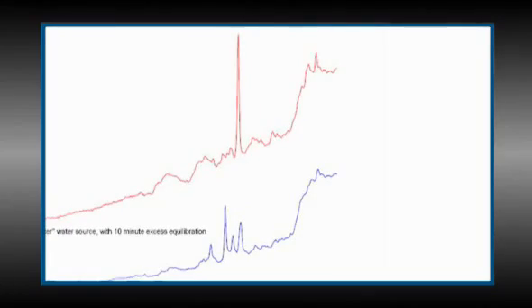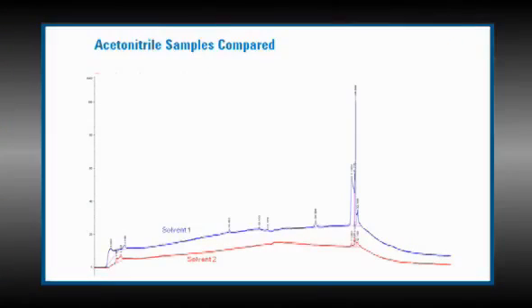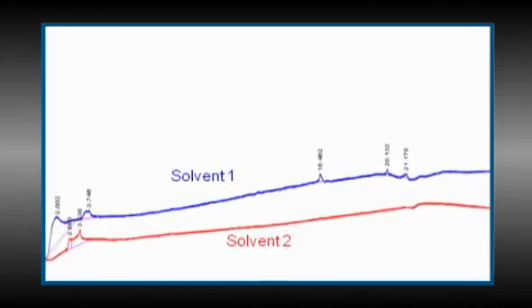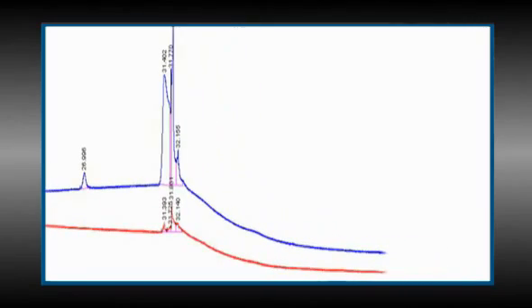It's also possible that the contamination is in the organic solvent. So again, use fresh HPLC grade solvent, possibly even from a different manufacturer. This chromatogram shows the background response from different sources of acetonitrile. Note in the lower chromatogram the absence of small peaks present in the upper trace. Another approach, if you're using acetonitrile, replace it with methanol or vice versa. A way to demonstrate that the ghost peaks are from the mobile phase is to vary the gradient.